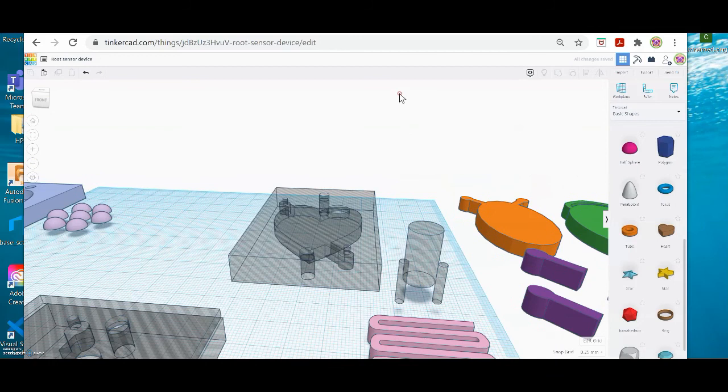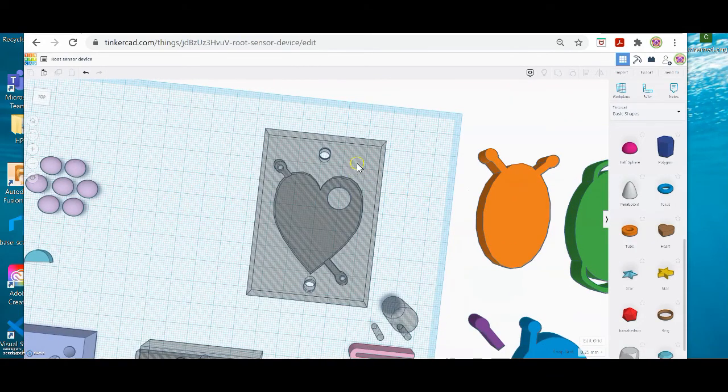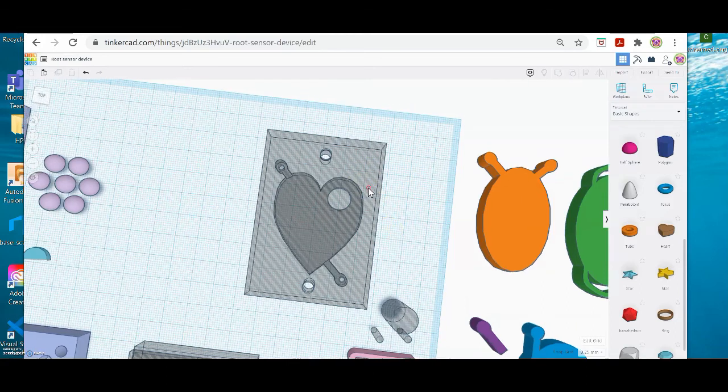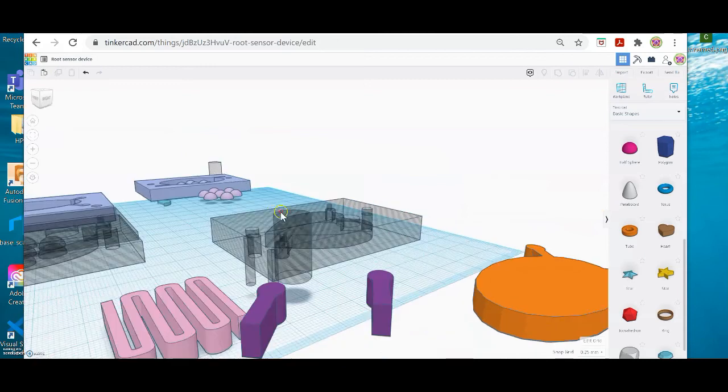So my final design has a lid. It's all one shape now. It's going to print as one form. So the lid now is fused with the base. There is an area for the liquids. There's a hole that goes into that area for the seed, and then 2 ports for dropping in liquids.